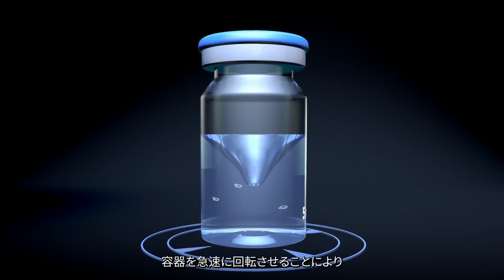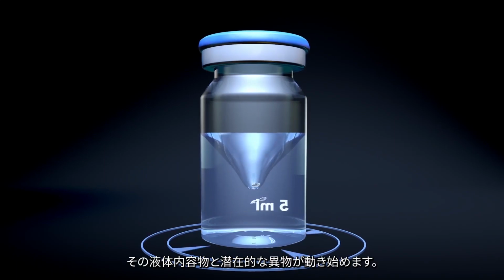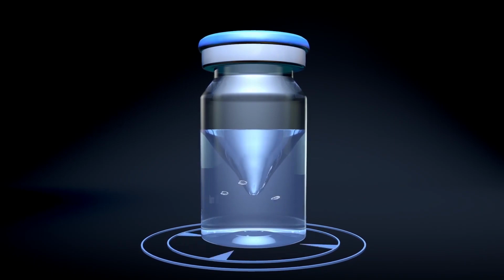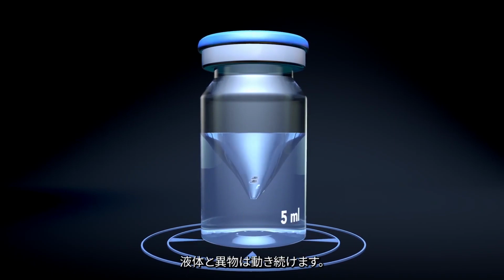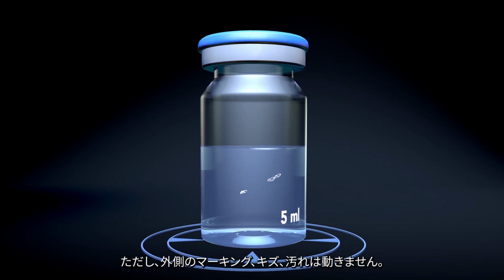By rapidly rotating the container, its liquid contents and potential particles are set in motion. Once the rotation of the container stops, liquid and particles keep moving. Markings, scratches, and contamination on the outside, however, are no longer moving.